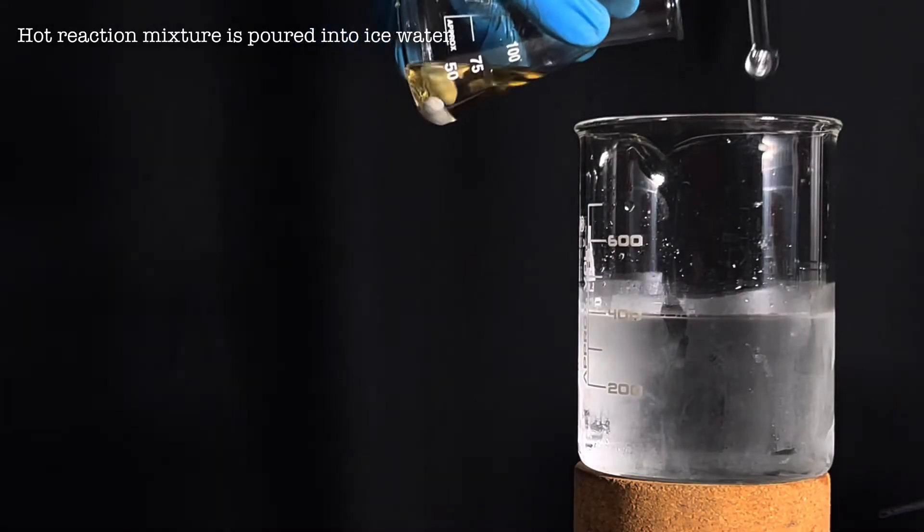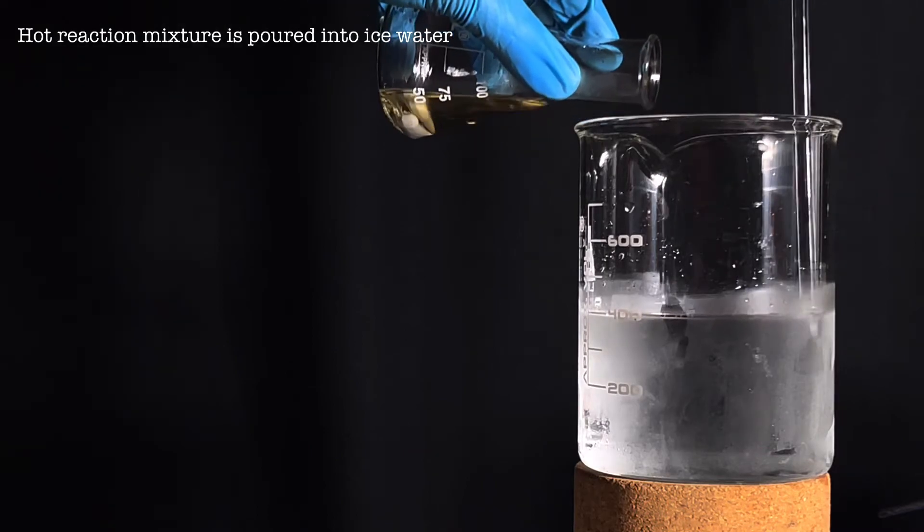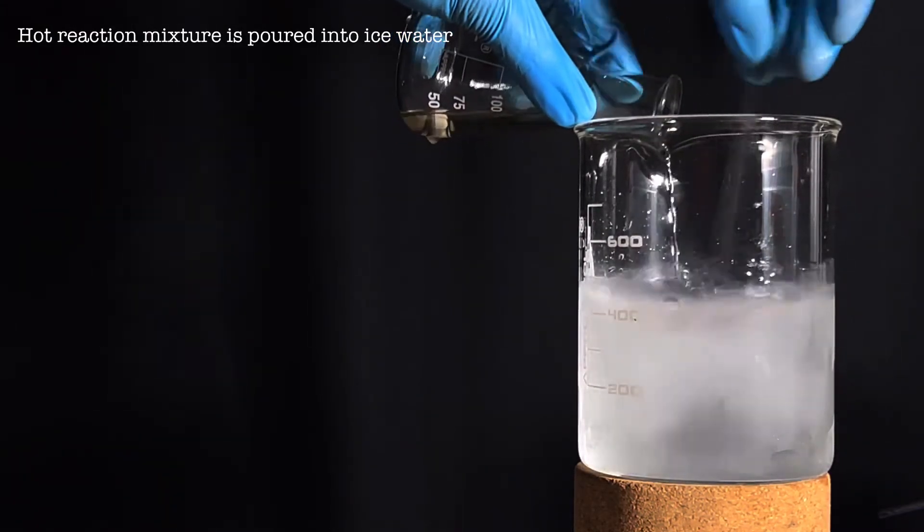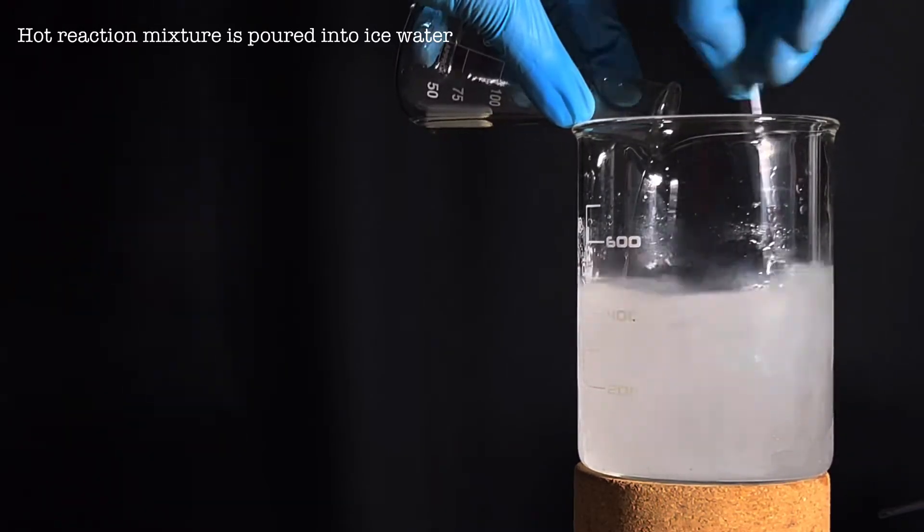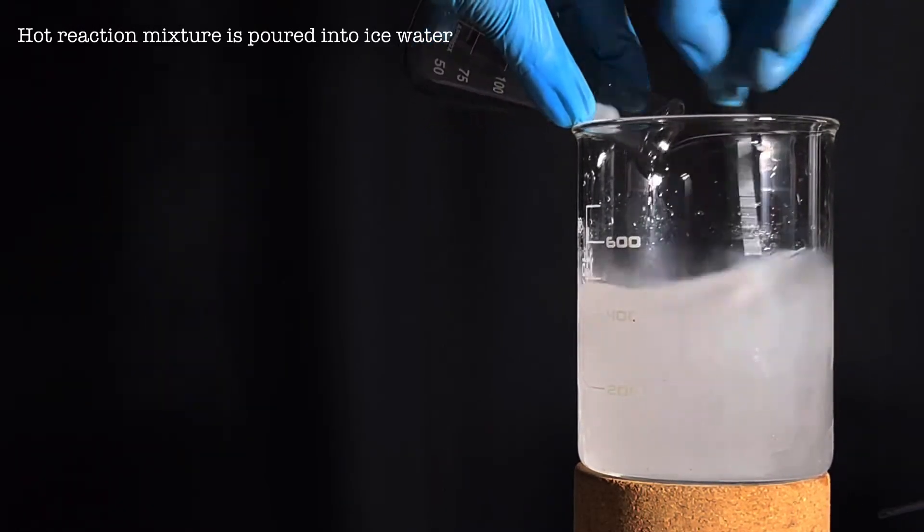After 15 minutes of heating, the hot reaction mixture was poured into ice water. Here there was a minute mistake from my part—I used cold water without ice cubes.